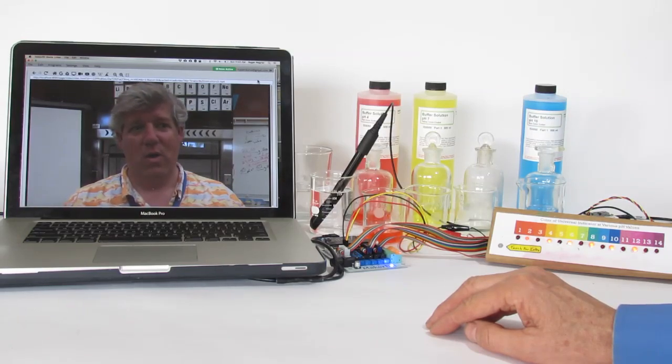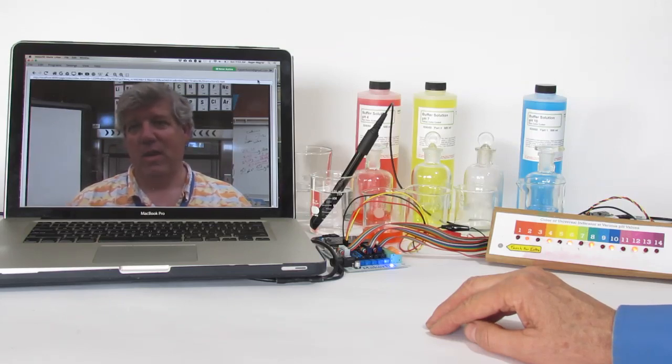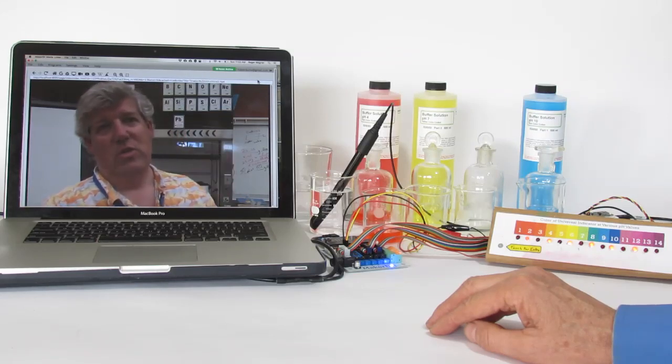Please remember to go ahead and record your volume of your unknown acid in your beaker and the volume of your known sodium hydroxide which is in your burette. Okay, let's get going.